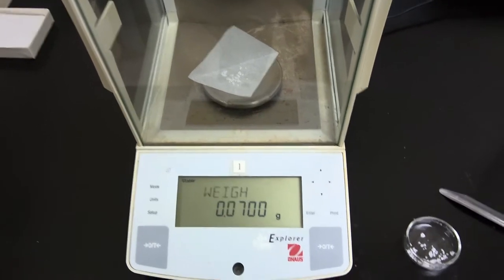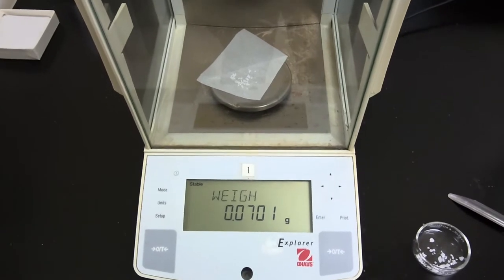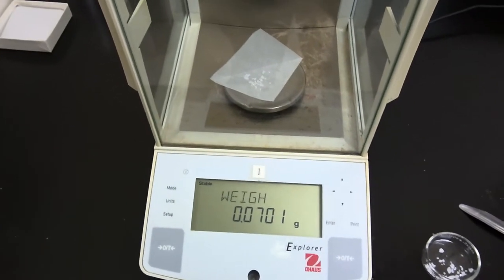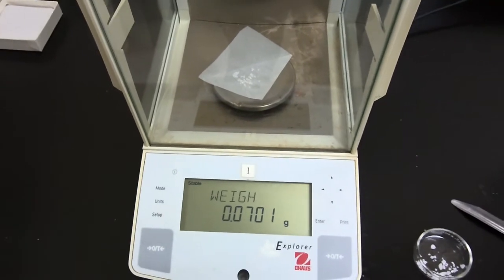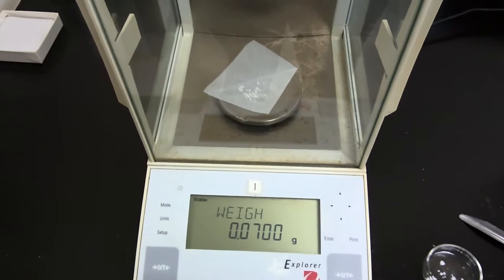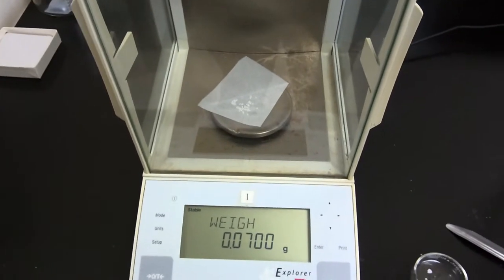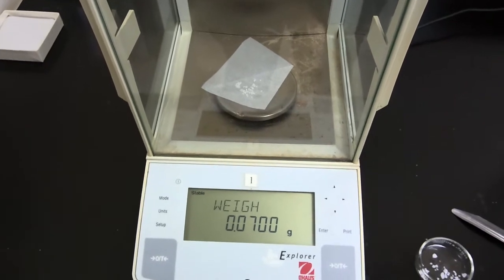So we finished weighing our reactant lauric acid. I'd like you to record the mass of lauric acid that we will use in this reaction for experiment 8A. We're going to add this to our conical vial, and then we'll add our ethanol solvent and reactant, and then we'll add our acetyl chloride catalyst to generate the trace amount of hydrochloric acid in situ. So we'll resume once we've added all of our reagents into our conical vial.